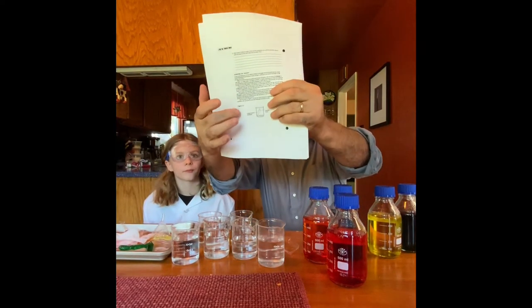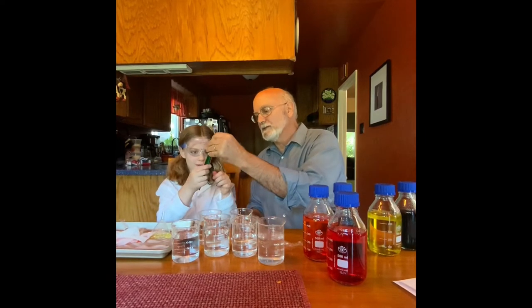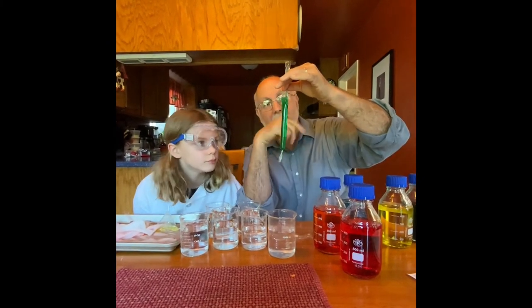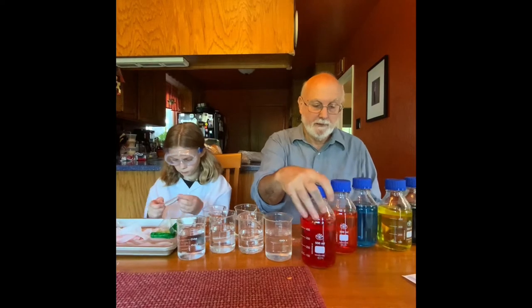The first portion: as you can probably see, there's a beaker with a tube containing some liquid. What we're going to use is called dialysis tubing — it's a semipermeable membrane. It allows water to go through but not glucose. Joe has sugar water, so we have sucrose inside the bag. The bag is impermeable to the sucrose, but water can pass through it.